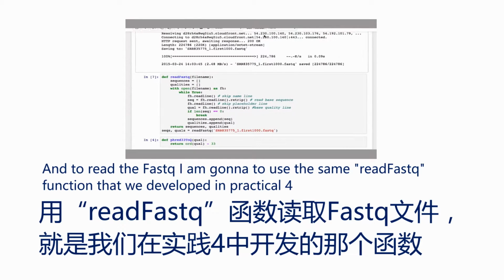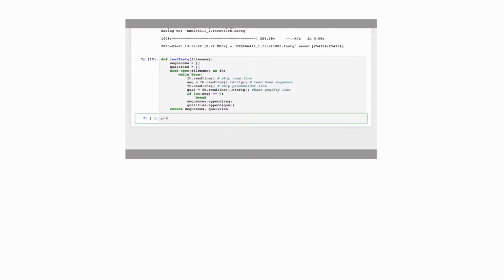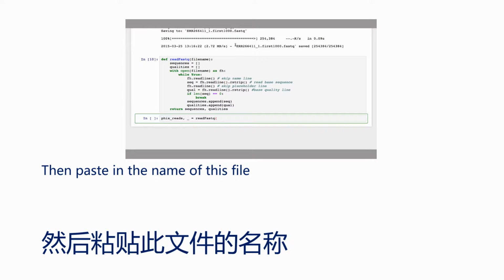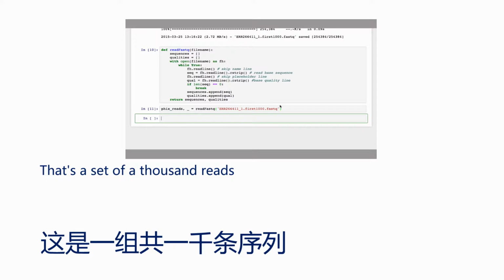And to read the FASTQ, I'm going to use the same read FASTQ function that we developed in Practical 4. So I'm just going to paste that in here. And I'm going to use that to actually read the FASTQ file. This function actually returns qualities too, which in this case we're not interested in, so I'm just going to use a blank to indicate that we don't want to save that to a variable. I'm going to paste in the name of this file. And so this has downloaded the sequencing reads from that file, and that's a set of 1,000 reads.